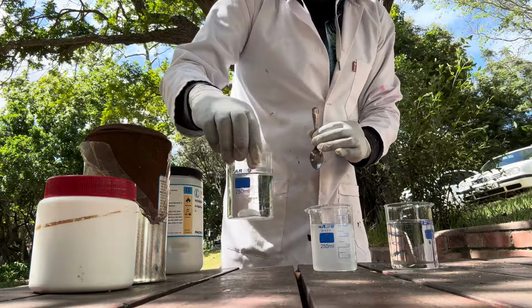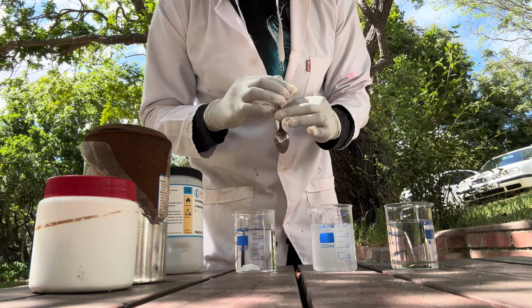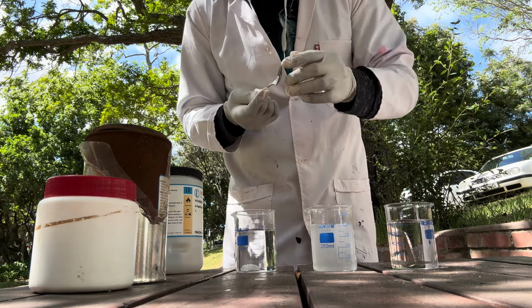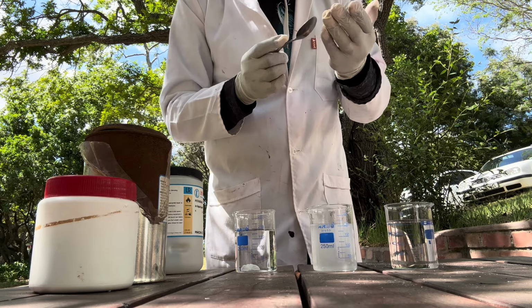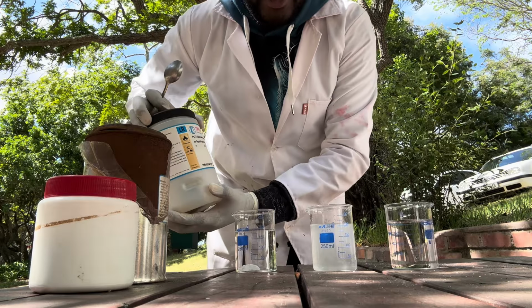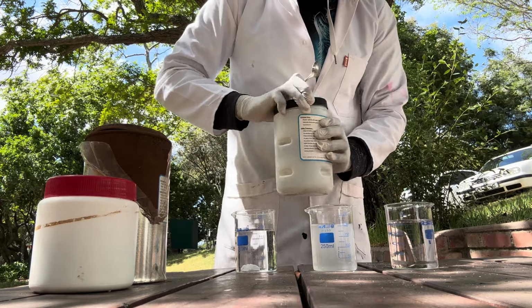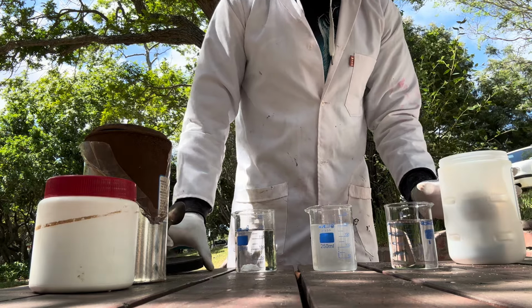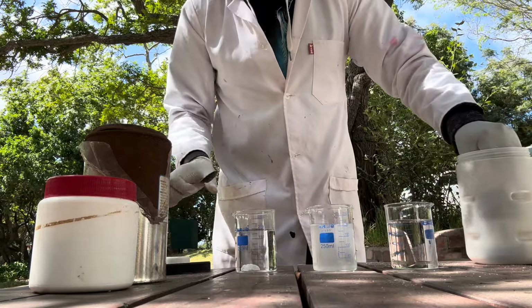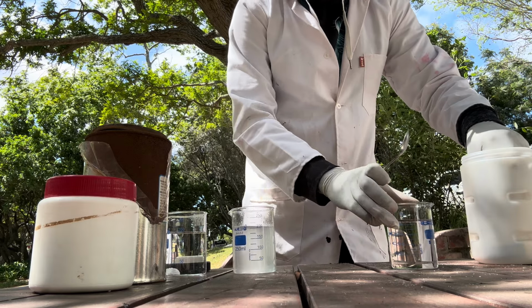We still have lithium still reacting, and sodium has completely reacted. The explosions that you were seeing is the hydrogen, actually. That's the hydrogen being repelled from the solution, and because of its really high reactivity, it makes those sparking and explosive sounds. So potassium is gonna be even much worse than this. So let's see how that goes. We're gonna try and put a little of potassium there. It might even break our beaker. Let's just hope it doesn't.